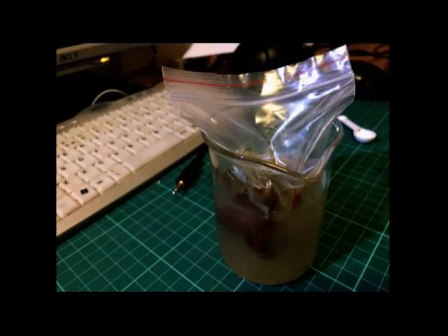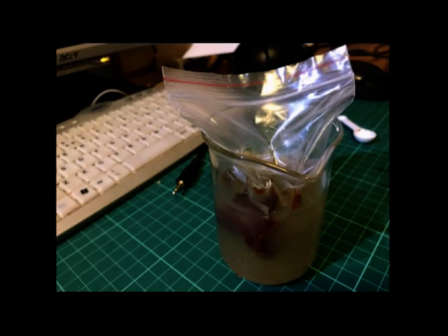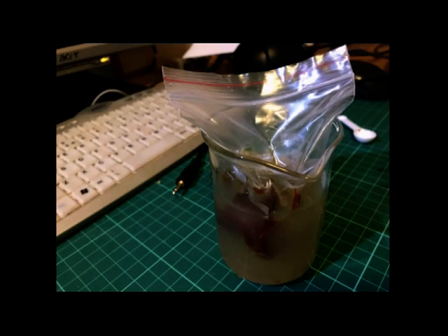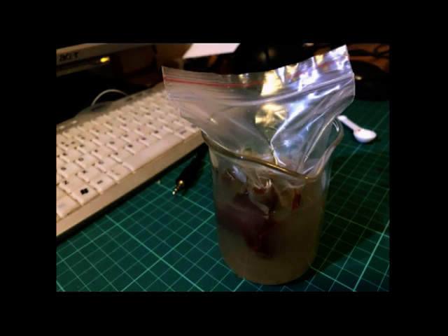Out of interest, we looked at how the reaction would be affected if we do all the same steps, but placed the copper sulfate and potassium iodide in the beaker after the solution cooled down. As I predicted, the diffusion did not take place because there was not enough energy for diffusion. This is because heat is an important factor, as it is needed for the particles to pass through the plastic and move with energy.